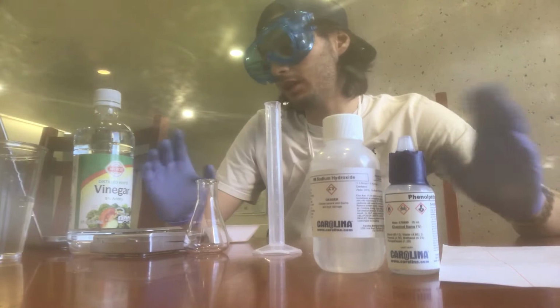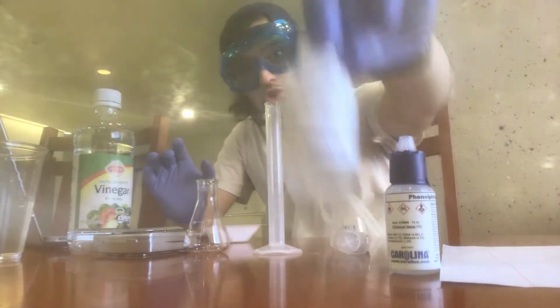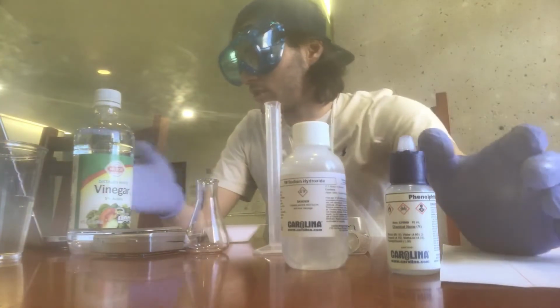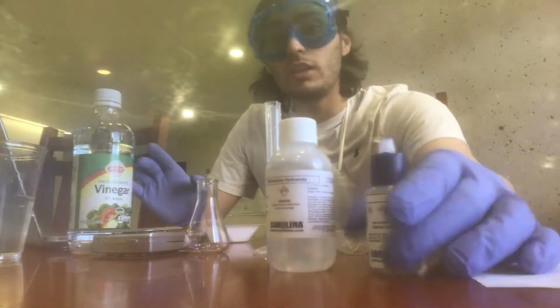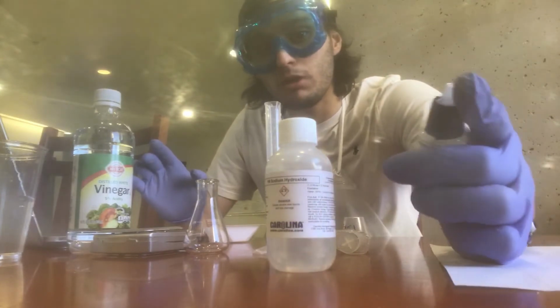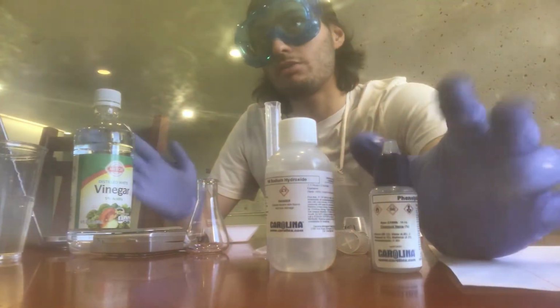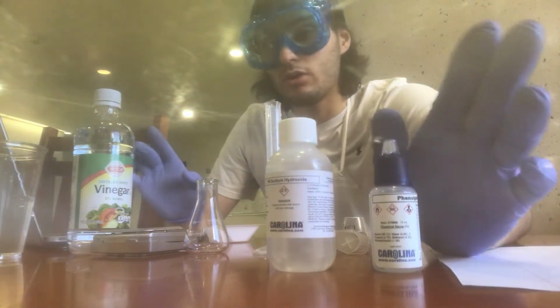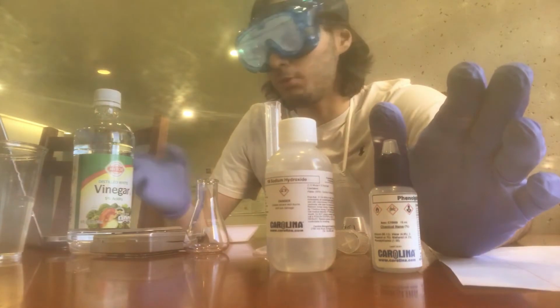So in this acid-base titration, the titrant is the sodium hydroxide, which is delivered through a syringe in order to precisely measure. Because in a titration experiment, being precise with your measurements is extremely important, because even 0.1 or 1 ml could make a big difference, even though 1 ml is barely anything.